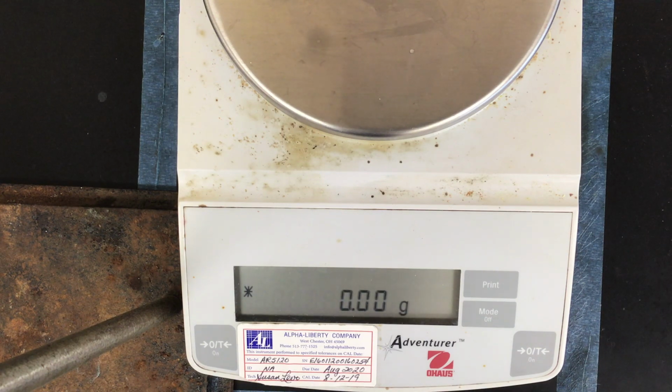You'll be using that mass to tell me how many moles are in each sample and ultimately how many particles, atoms, molecules, formula units are in the sample. So I'm going to go through these one at a time. They're in no particular order. Again, you need to match them up with the appropriate chemical name on your data table on the handout. So you might be jumping around your table a little bit while we go through this.